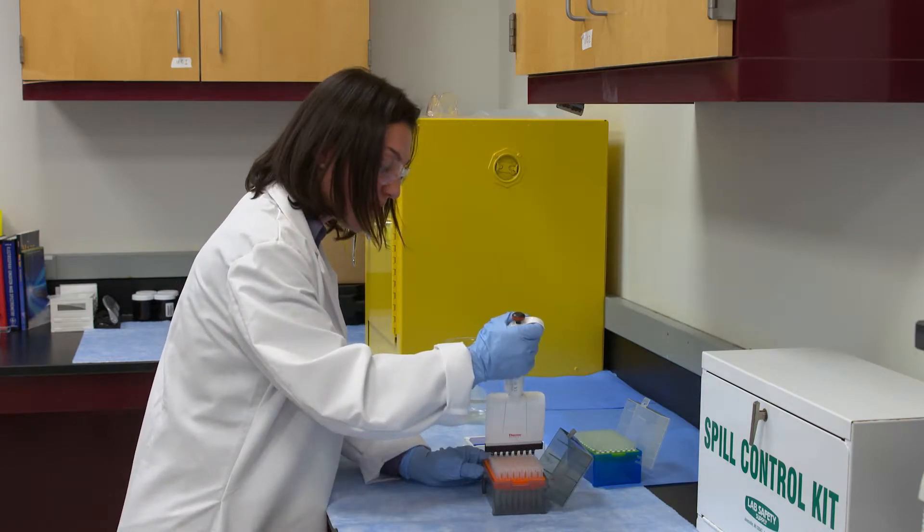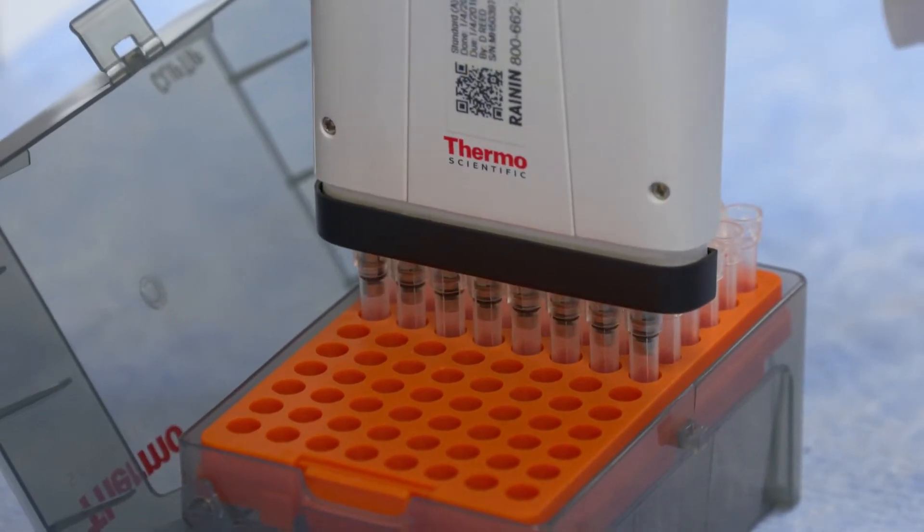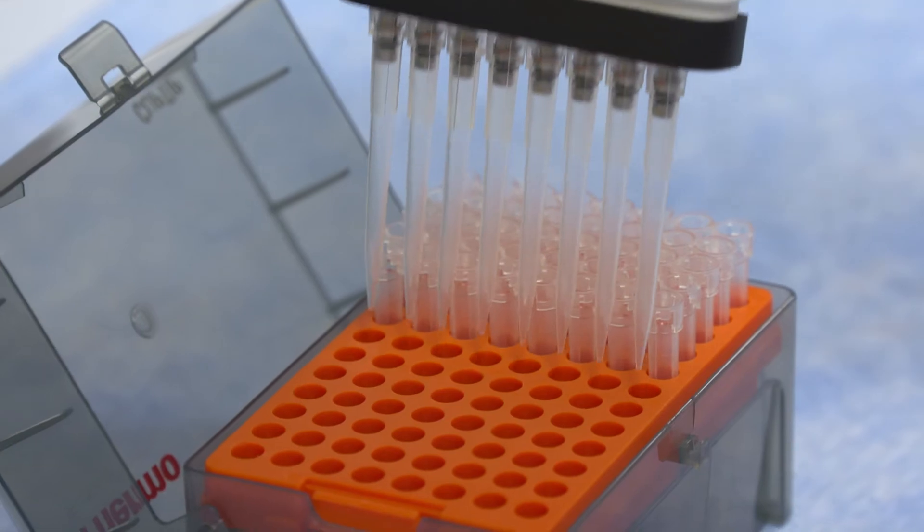So I'm just going to press firmly down and collect my tips.